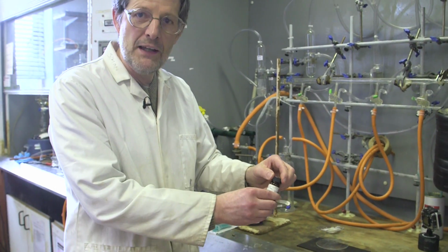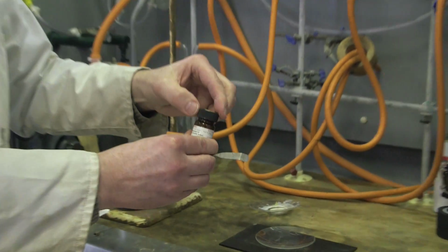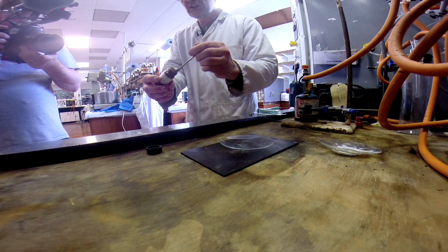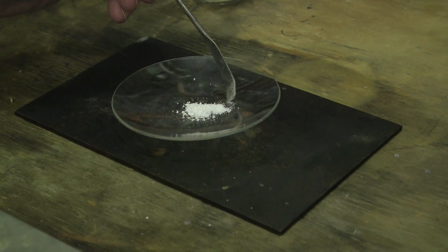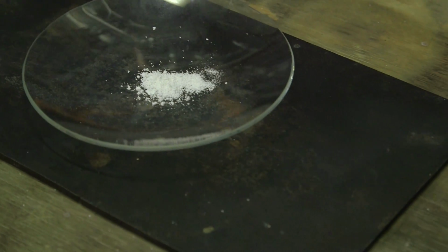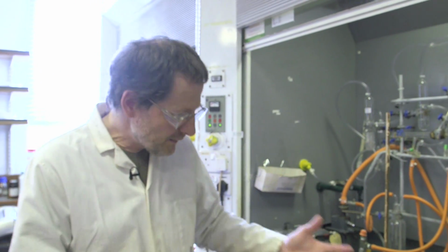If you remember the flames, you should be worried when I'm going to take the top off here. And I can see a little bit of the fear in your eyes. But if you see here now, well, it's a whole new ball game. Just by making the adduct, instead of having a liquid, we've got a white powder, it's crystalline. It's free flowing. I'm only going to put a little bit down here because I don't want my watch glass to crack. But as you can see, even if you are a relatively inexperienced chemist, that's much easier to work with.